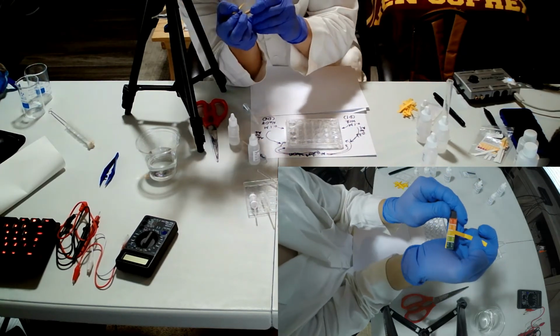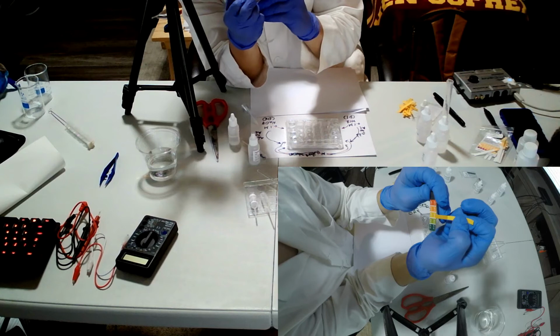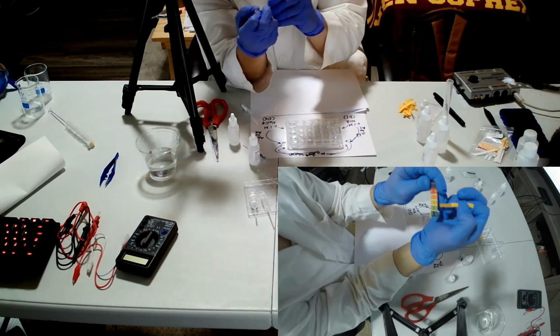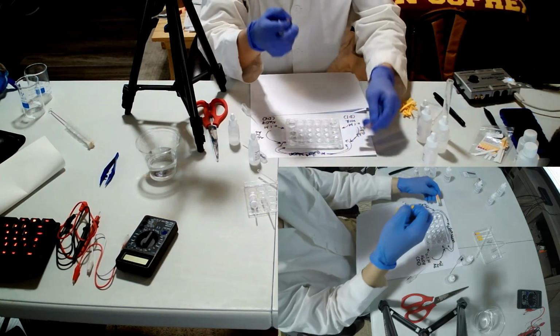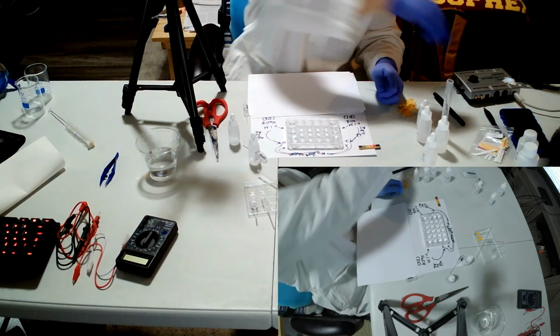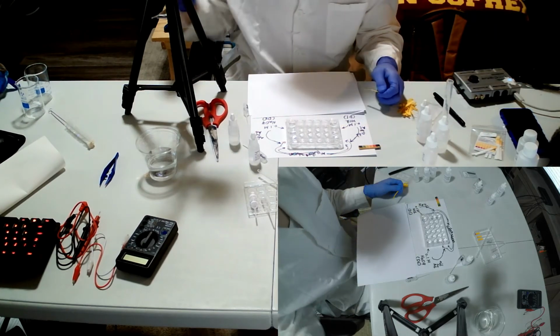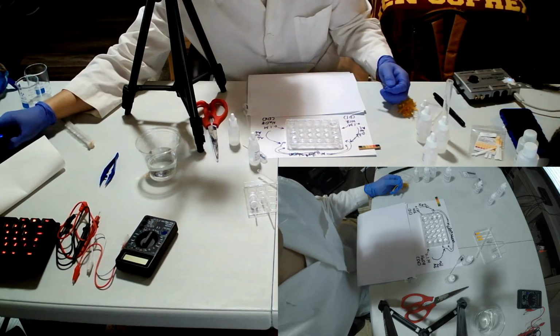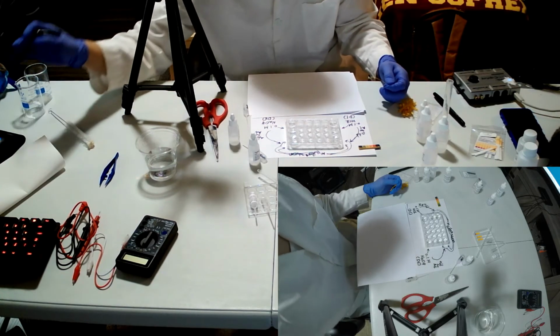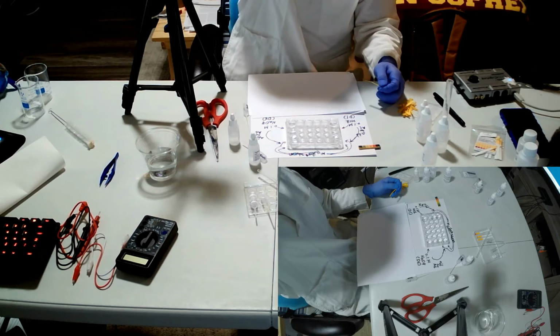See that? But it looks like pH 6, near to pH 6. So I'm gonna record it. So it was A1, right? A1. So you can fill that out in the hands-on lab web page, data table 1.